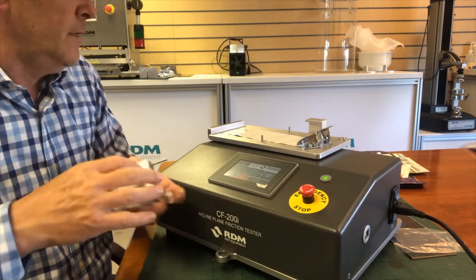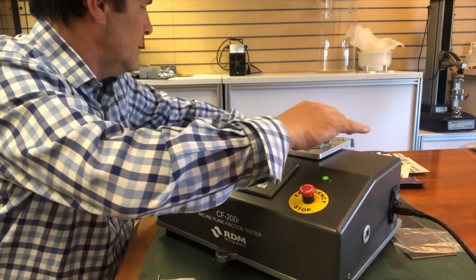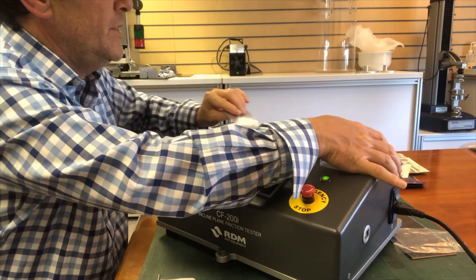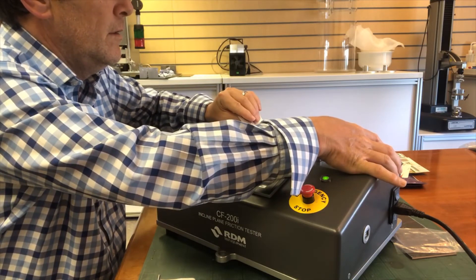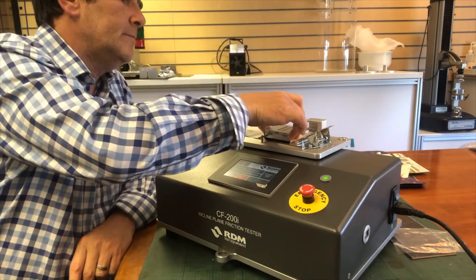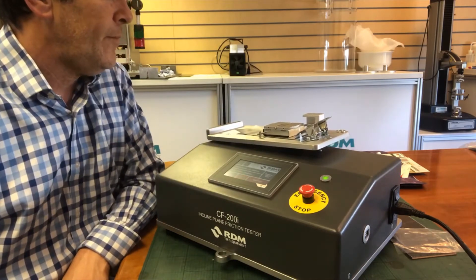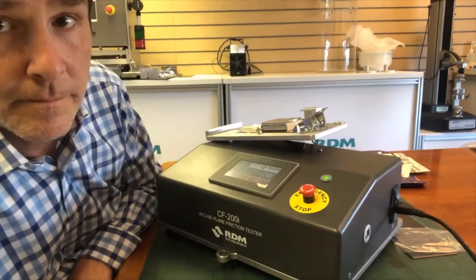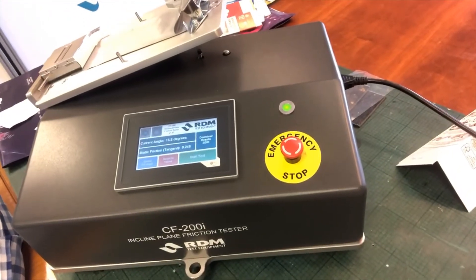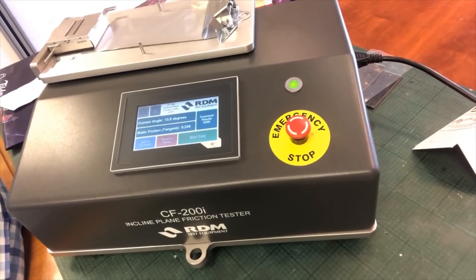I've got another sample here. This time I'm doing it on the other side of the material, and I'm not forgetting to change the base sample as well. I'll load that in and hit the start button again. You can see the value on there — the static friction value of 0.246.